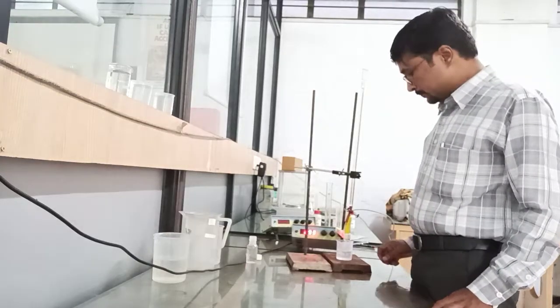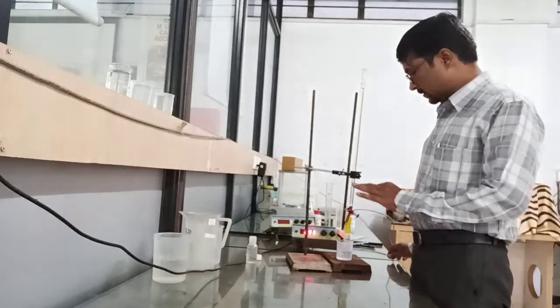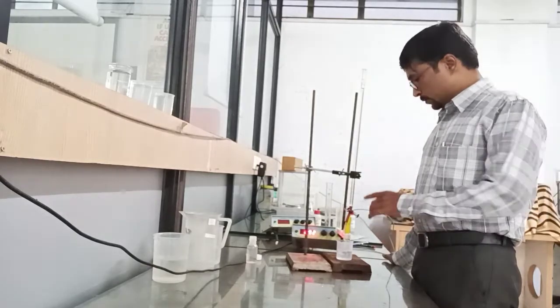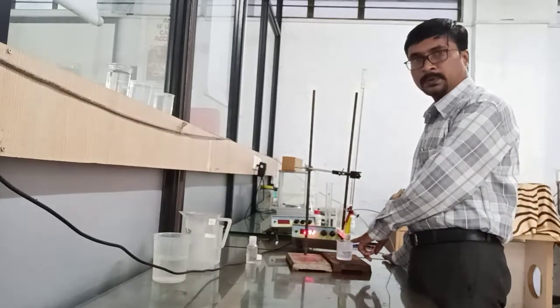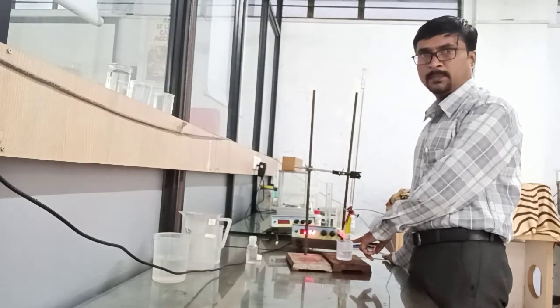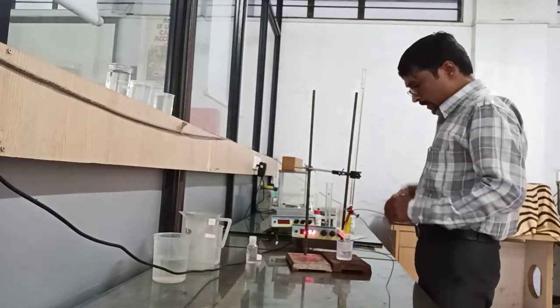Hello, welcome. In this session, we are going to determine the strength of commercial grade nitric acid by using the pH meter. For this experimental purpose, I have taken 1 ml of concentrated HNO3 and 50 ml of distilled water.